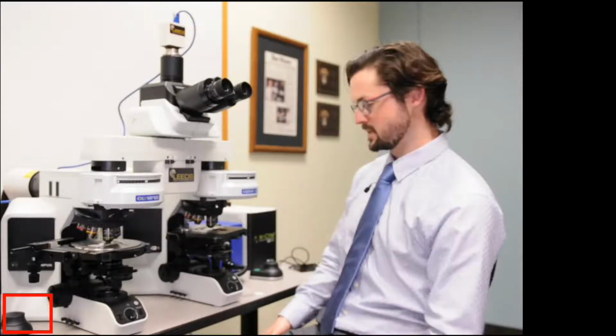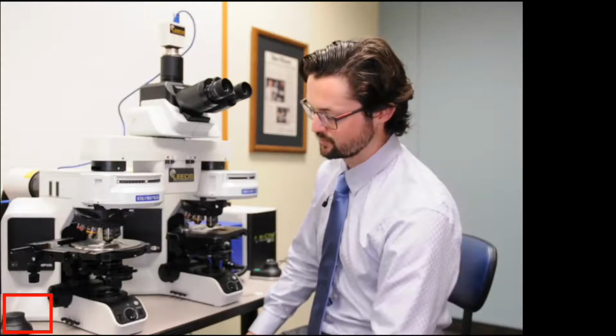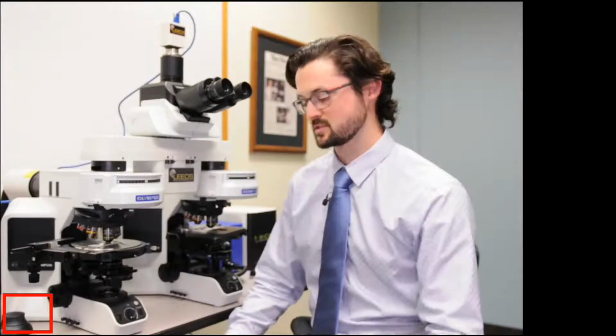So, jumping in a little bit, there are a couple different ways to do Kohler. What I'm going to show you is the way that I was taught how to do Kohler. It's a technique. I'm sure people have very strong opinions and have their own versions of it.